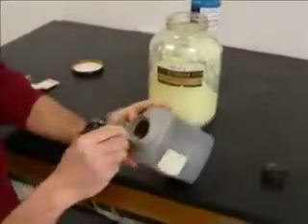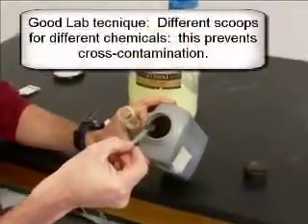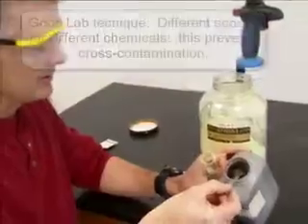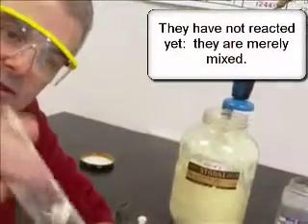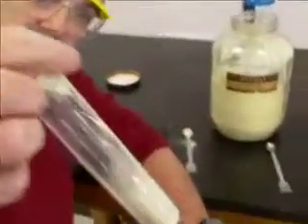Now notice one thing I am doing as I'm mixing these. Notice I have different scoops for each of them because I do not want to put sulfur into the iron. It's not a good idea. So here is iron mixed with sulfur. Now notice they're not reacting, they're just kind of mixed together, sitting there. So I'm going to shake them up, mix, mix, mix. And they still haven't reacted.